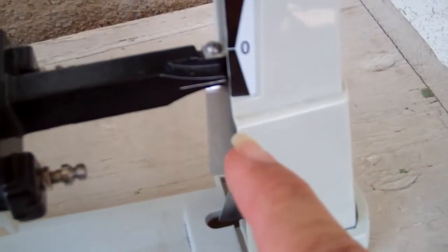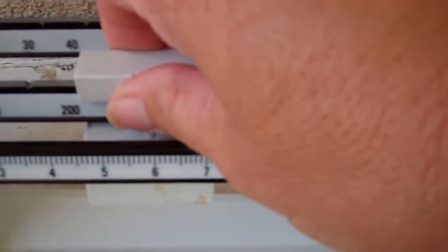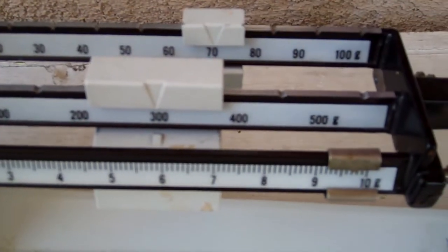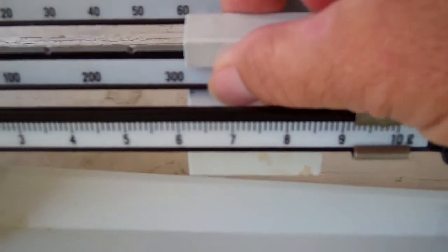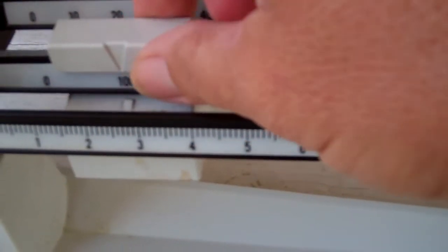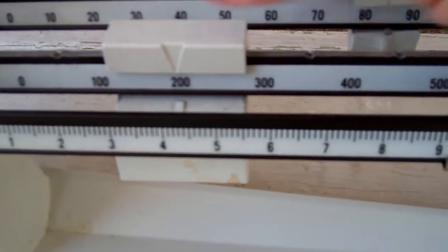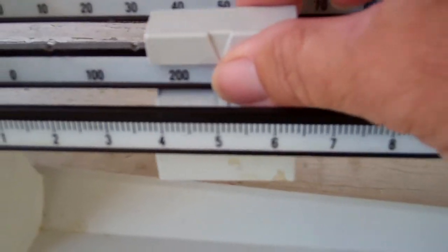So let's try and find something that's a little less. And it went down. It's too much. So you gotta move these riders around.